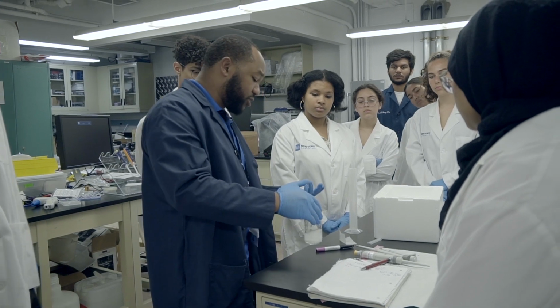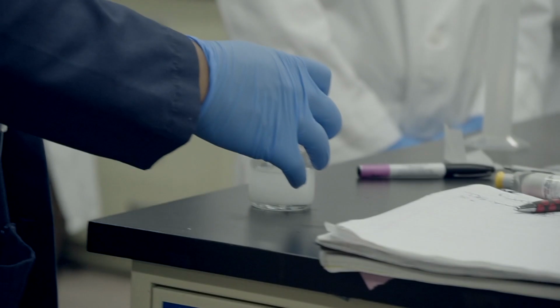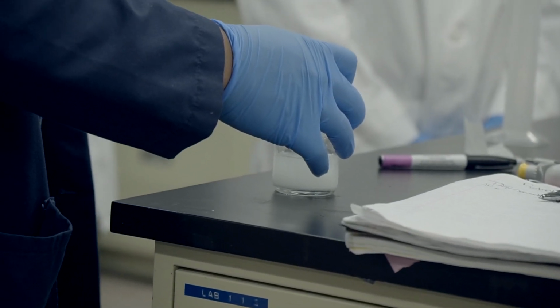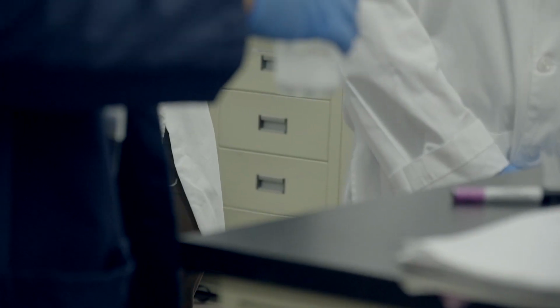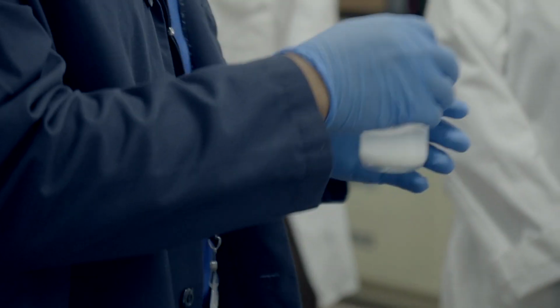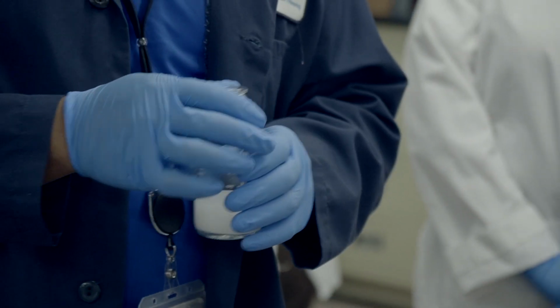Excellent. And again, we were saying we're making a 2% gel today for various procedures. If you're looking for different fragments, it might be longer or shorter. You can alter the percentage of gel. It's just going to take more time or less time for it to run through. And so that varies based on different protocols. And so I might swirl this gently.